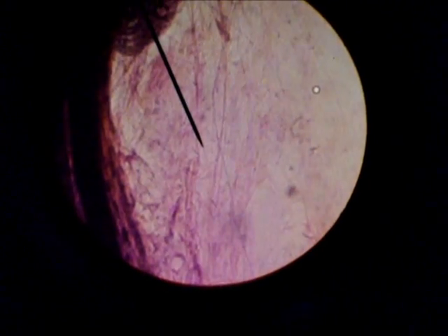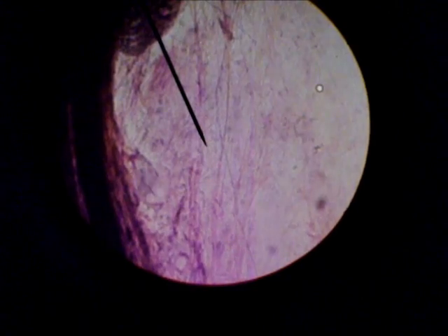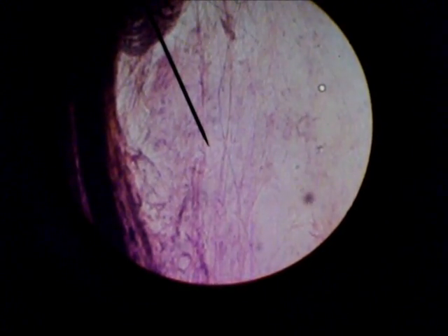This is loose connective tissue. Loose connective tissue.